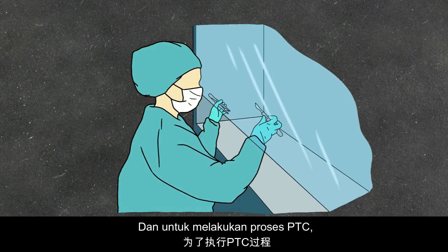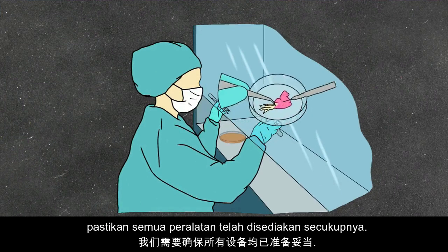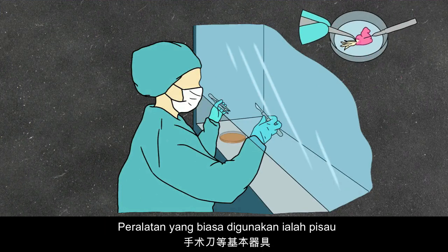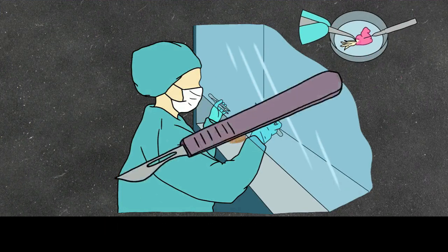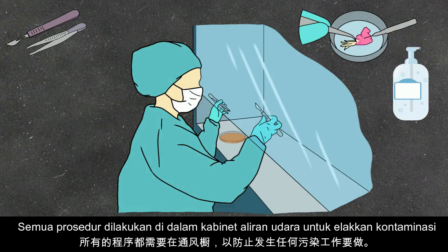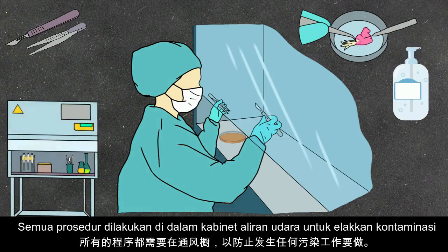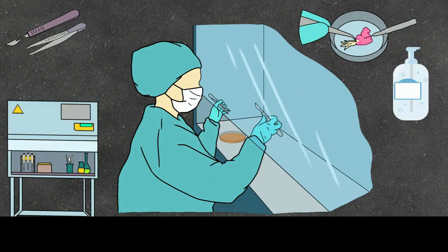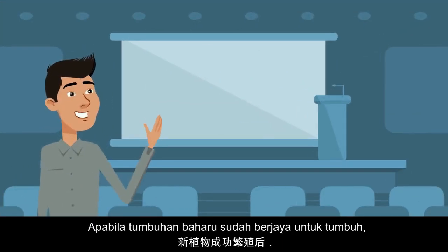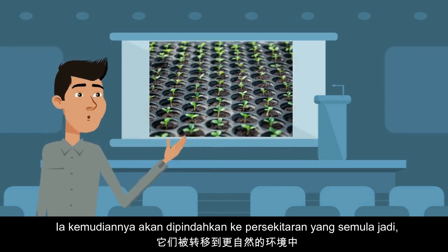To carry out the PTC process, we need to make sure all the apparatus are well prepared. Basic apparatus include a scalpel, forceps, and alcohol. All procedures need to be done in the laminar flow hood to prevent any contamination from occurring.